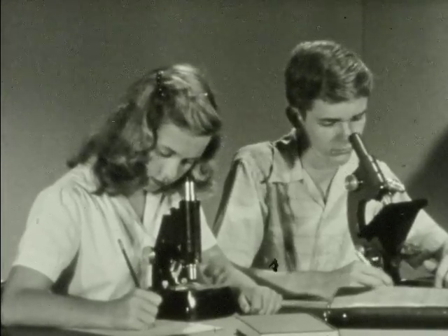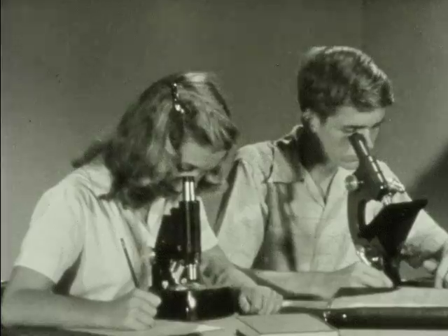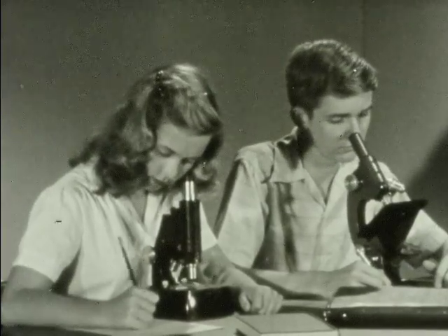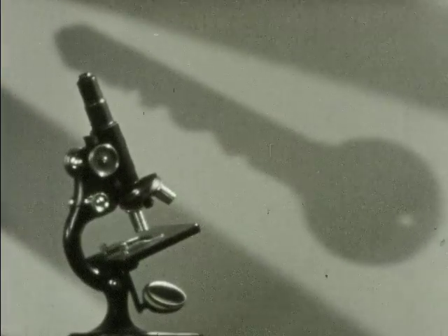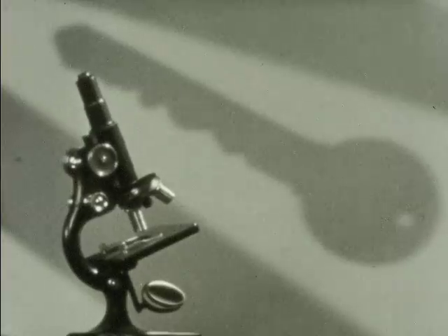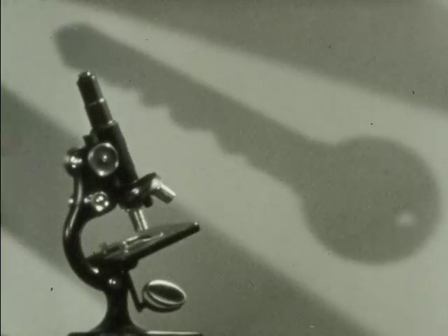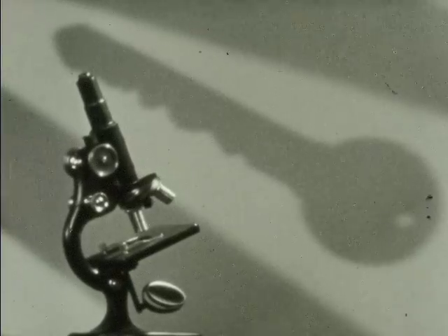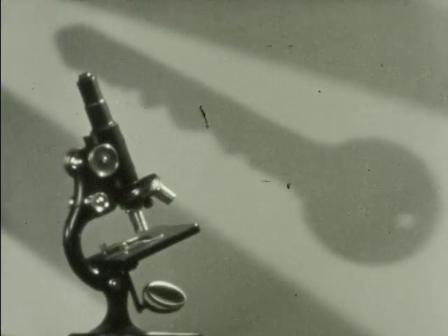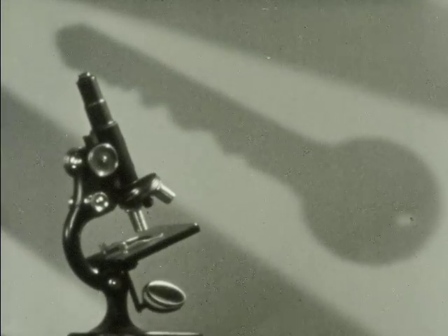Remember that by mastering the use and operation of the microscope, you are preparing yourself to use and understand even more complex scientific instruments. The microscope is your key to an unseen world. It is your key to knowledge and a better understanding of life itself. So use this key and use it well, for it may one day unlock the door to still undiscovered secrets of science.